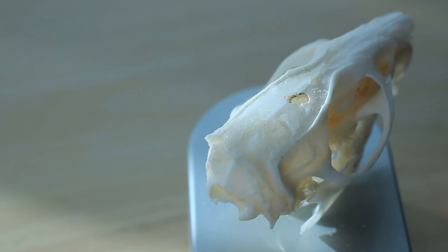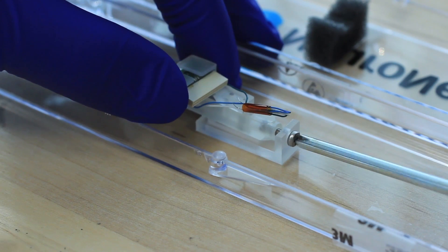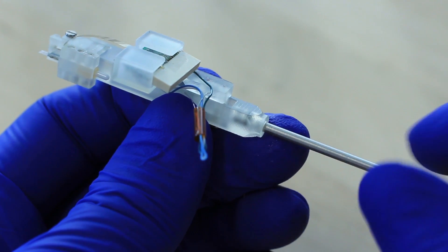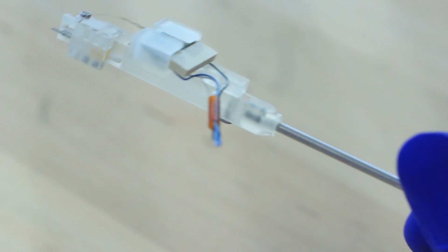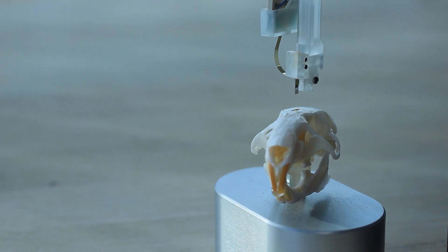After the animal has been prepped and the craniotomy performed, remove the sterile O-Drive and stereotaxic adapter from its packaging. Attach a 2 mm diameter rod to the assembled O-Drive unit, then mount the entire assembly onto a stereotaxic manipulator.